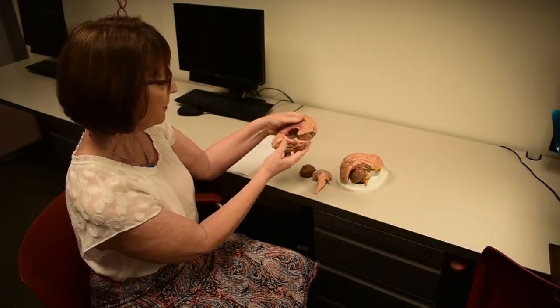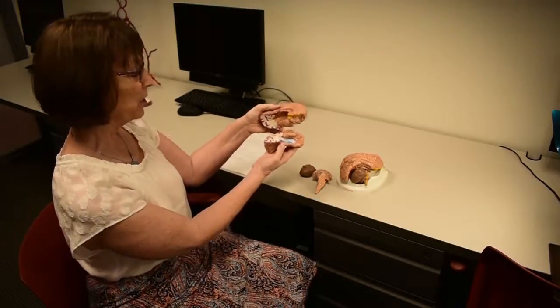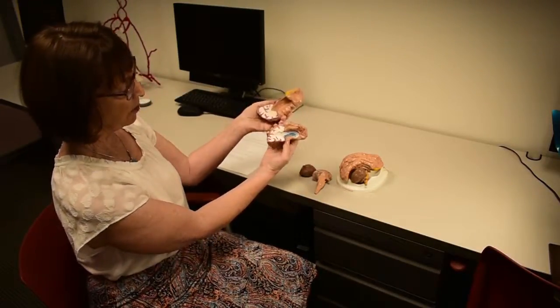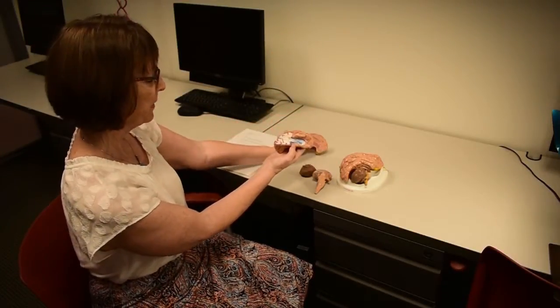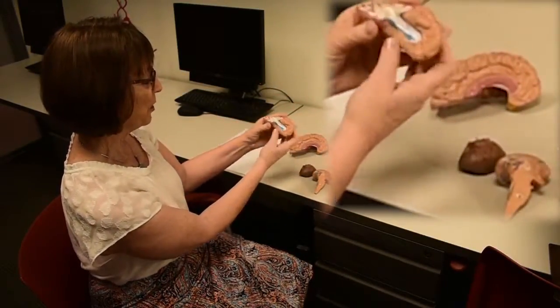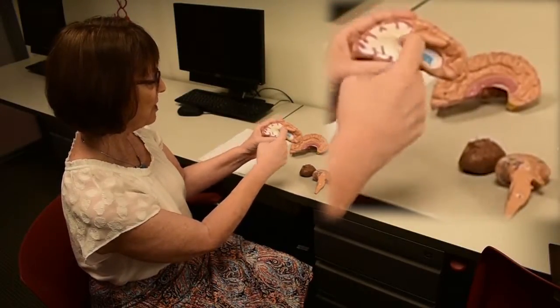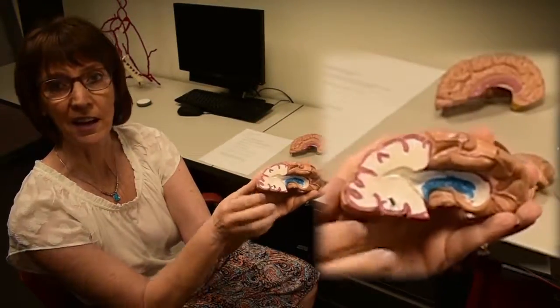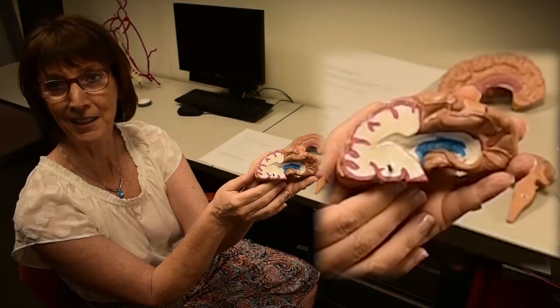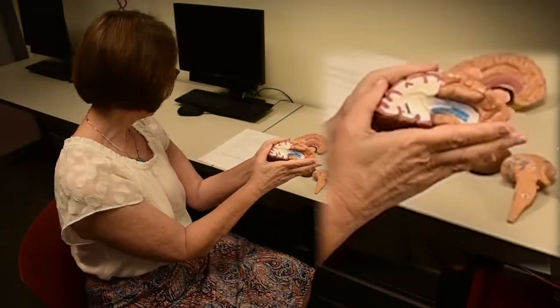So if we open this up and investigate this cavity a little more closely, you can see that it opens this way, removing this superior part. But looking at the inferior part, you can see that there's a shape there, and it comes to a point here. What is that, and what is it shaped like? Okay, so that's what we're talking about when you're looking at that question on your worksheet.